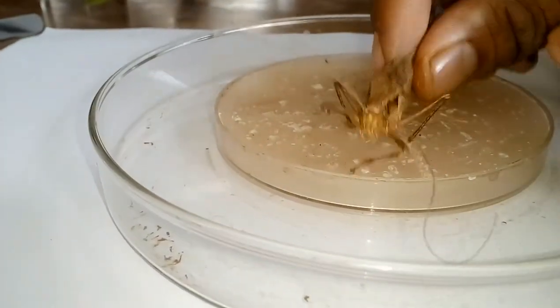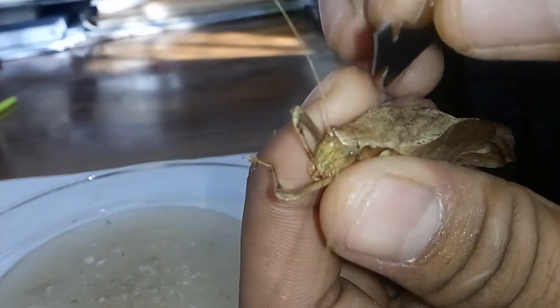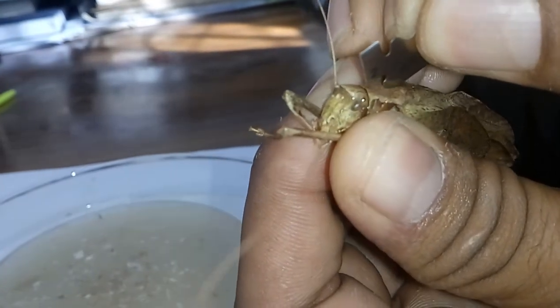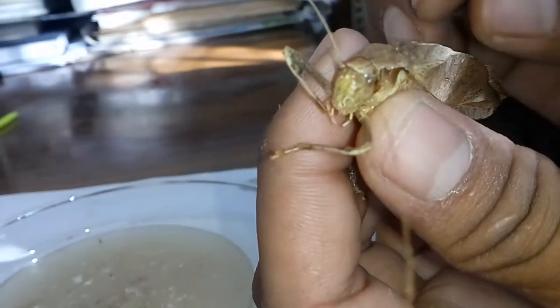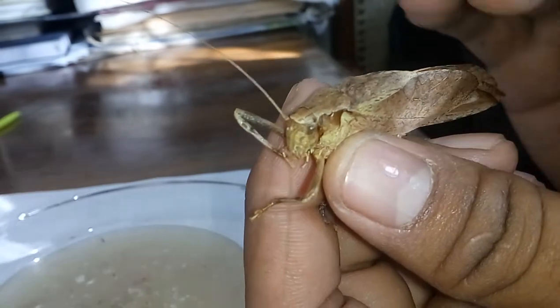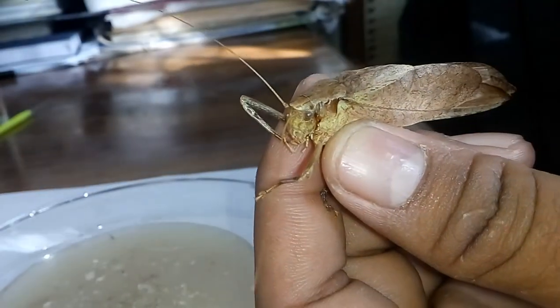I am just doing this — you have to look carefully at this area. Remember that all insects are always dissected from the dorsal surface, because they have a ventral nerve cord. That is why all insects are dissected from the dorsal surface.